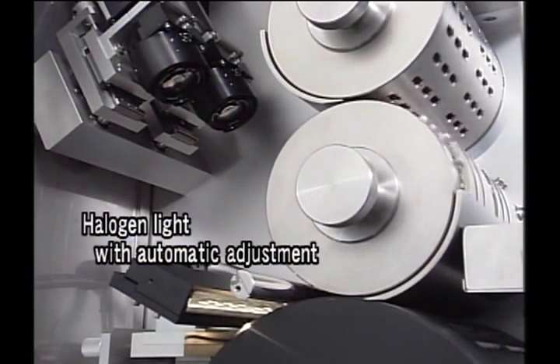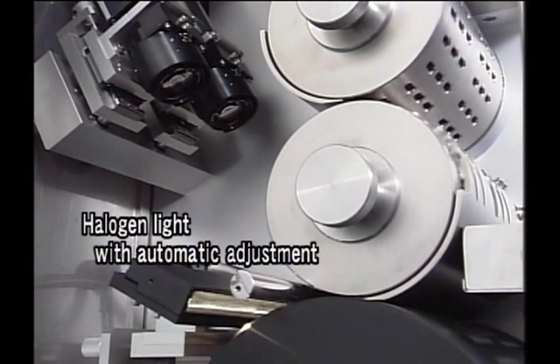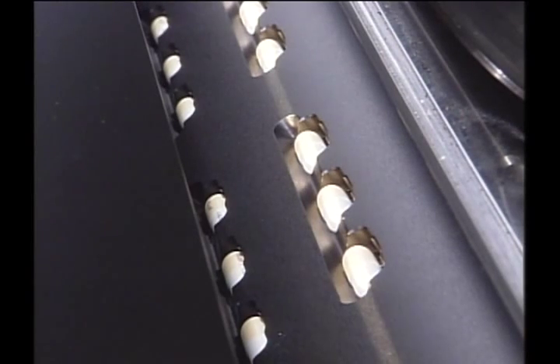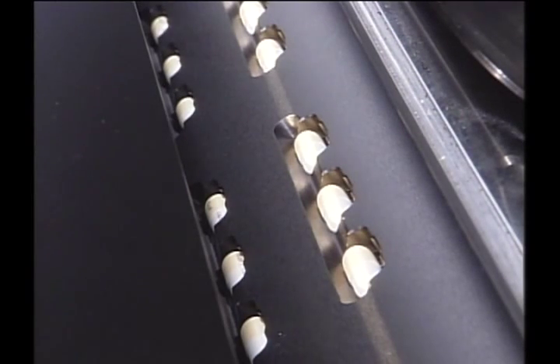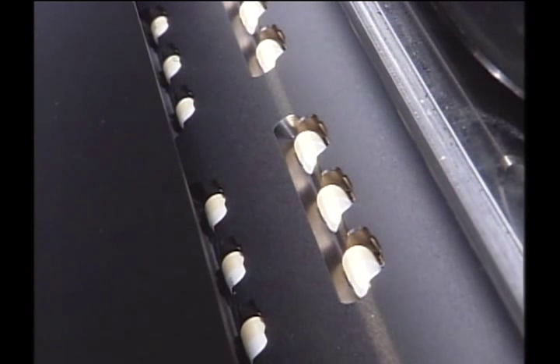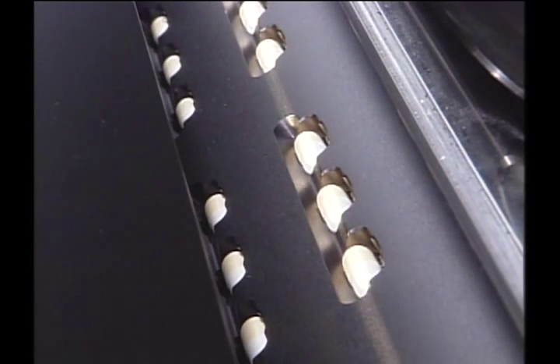The capsules are rotated by the inspecting drum, which then stops for a short while. After speedily scanning as many as 200 times and introducing the image data, it is judged by a designated parameter.